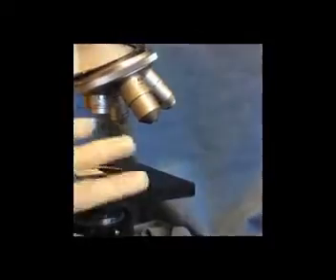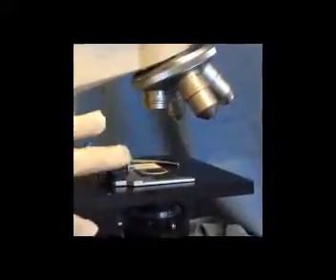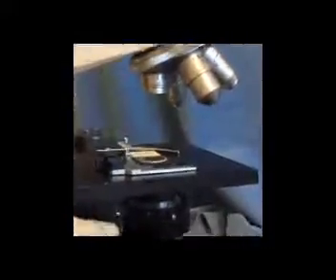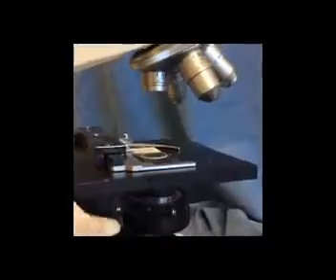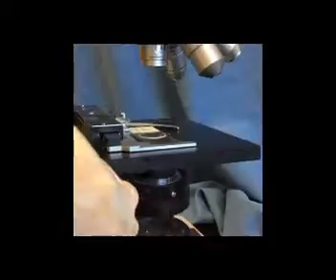All right. So since we're looking at a relatively large specimen, Spirogyra, it has pigment, it has chloroplasts, we could choose to lower the substage condenser, and beneath the stage there's a knob which controls elevation of the substage condenser. So you can see it's in the lowest elevation right now, so I could raise it, or I can lower it. By lowering it, I'll decrease the amount of light striking my specimen.